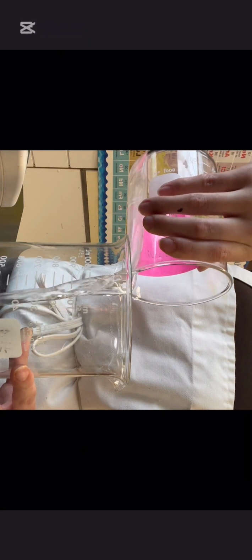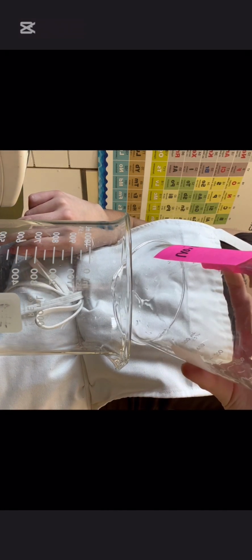Now I'm pouring both solutions, solution A and B, into a bigger beaker. And as you can see, when I show the solution, there is no visible change. We can't see anything. It's still clear. So that's when I add the indicator. At this point, I added quite a lot of it in, as you can see, and it turned a really deep green and then straight to red.